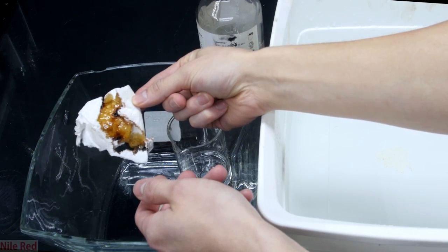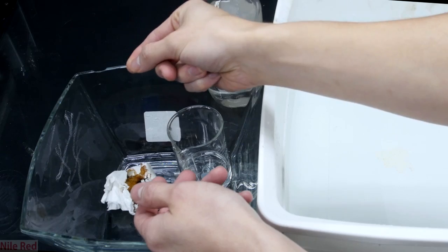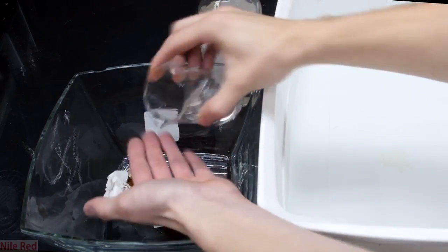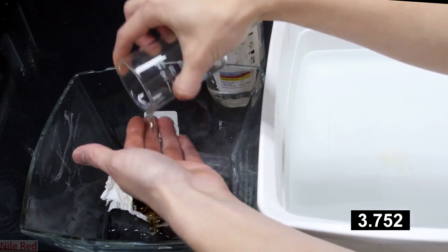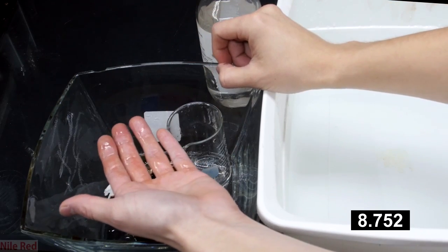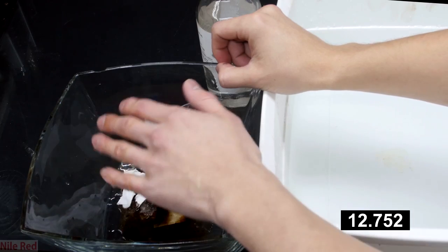Before I do this, I apologize for the pour angle and also for my sloppy pouring. I honestly have no idea why I poured it like this or why I was so sloppy. But unfortunately, this is one of those things that you can only do one take of. In either case, I still poured a bunch on my hand and the effect will still be seen.